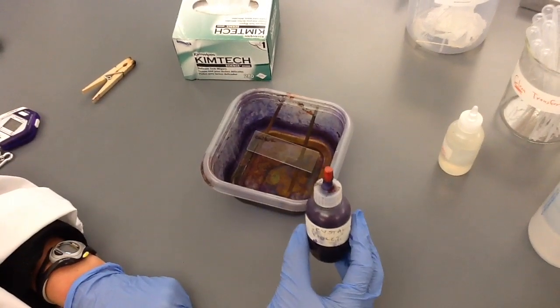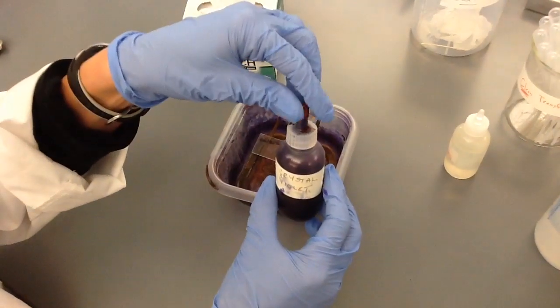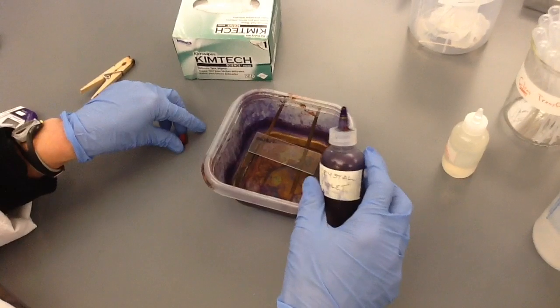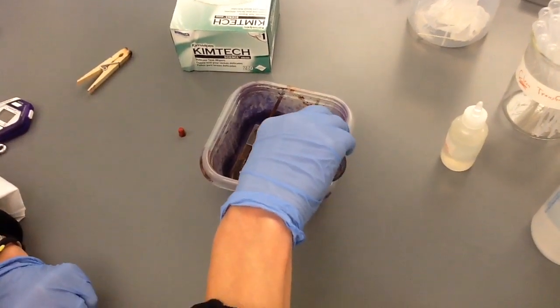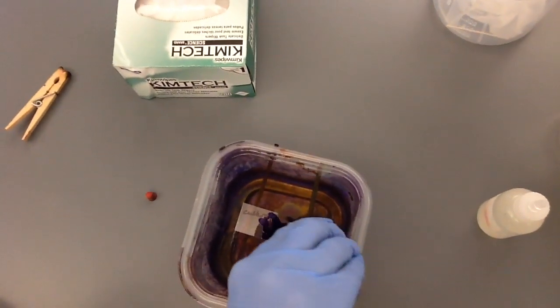A crystal violet stain is really simple. You take crystal violet stain and you soak the slide in it. So you want to apply it very generously.